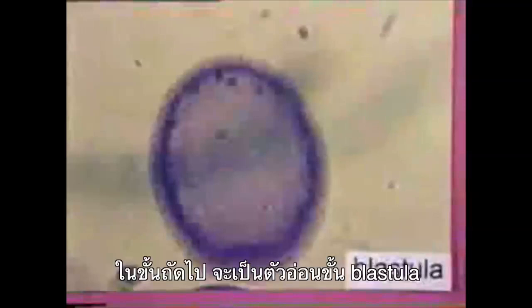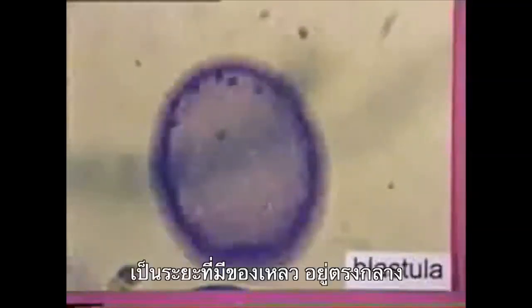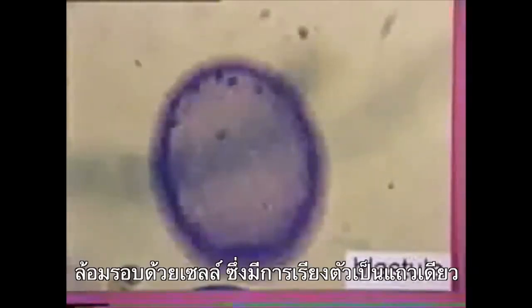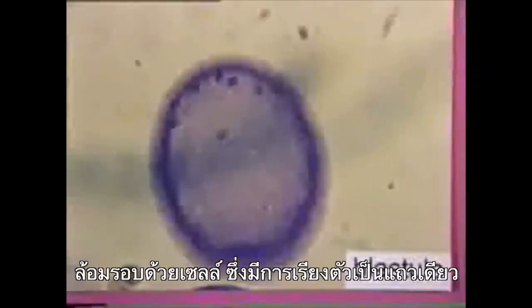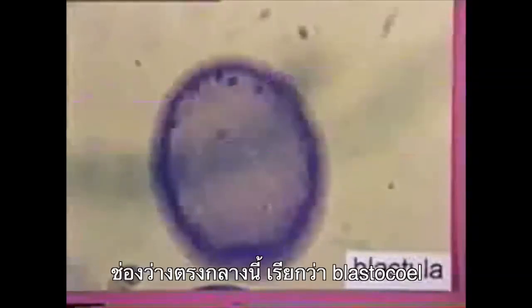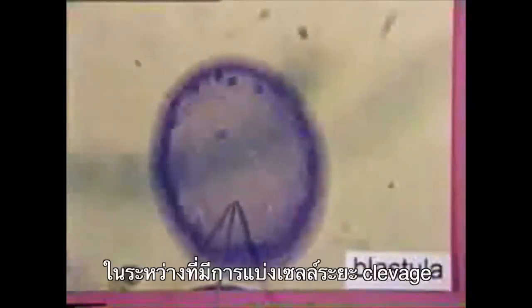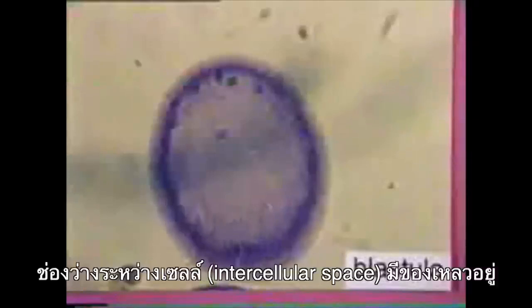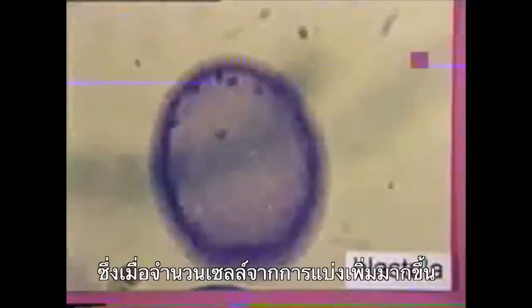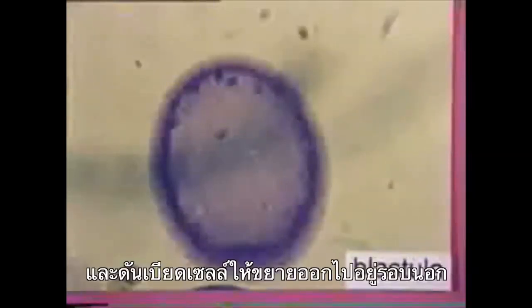As cell division progresses, the number of cells increases and the embryo develops into a morula. The next stage is called a blastula. The blastula has a fluid-filled space in the center surrounded by cells organized into a single layer. The space in the center is called the blastocoele. During the cleavage stage, the space between the cells is filled with fluid, and as the number of cells increases, the cells are pushed outward toward the outside.